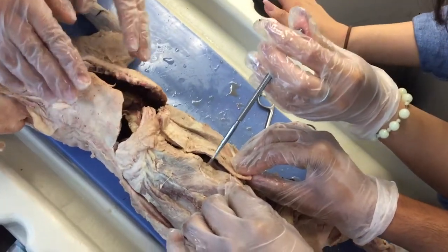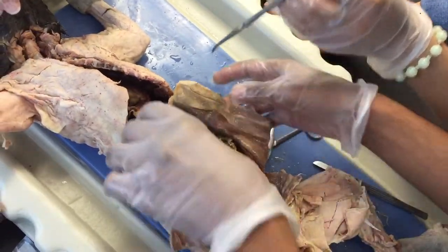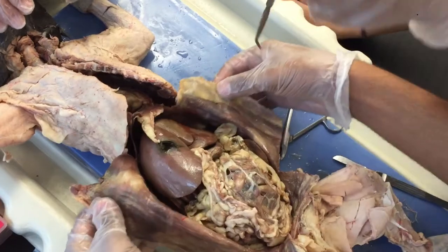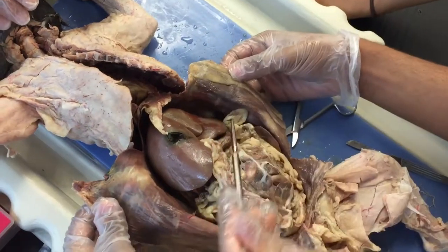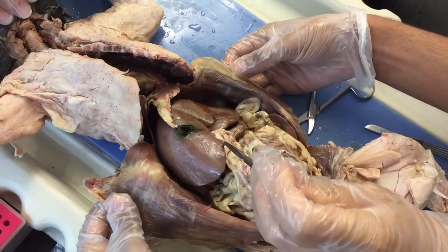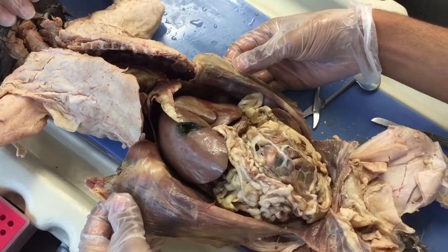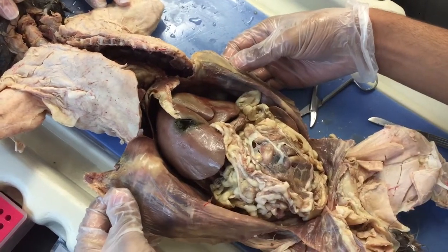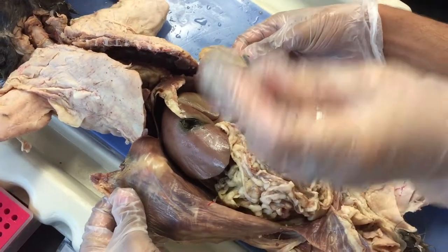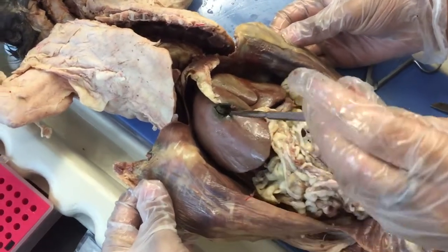Cutting through the abdominal cavity into the digestive system, you first see the liver, which is this big organ. It basically makes bile in the presence of fatty food and cholesterol.